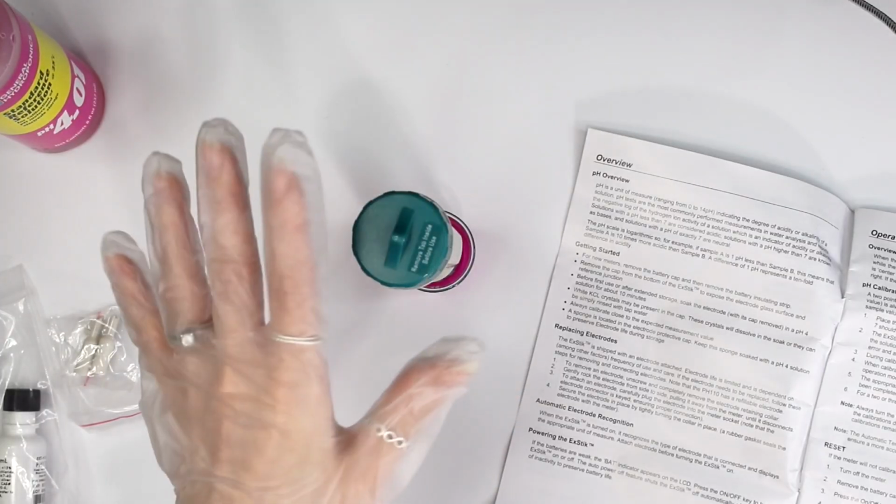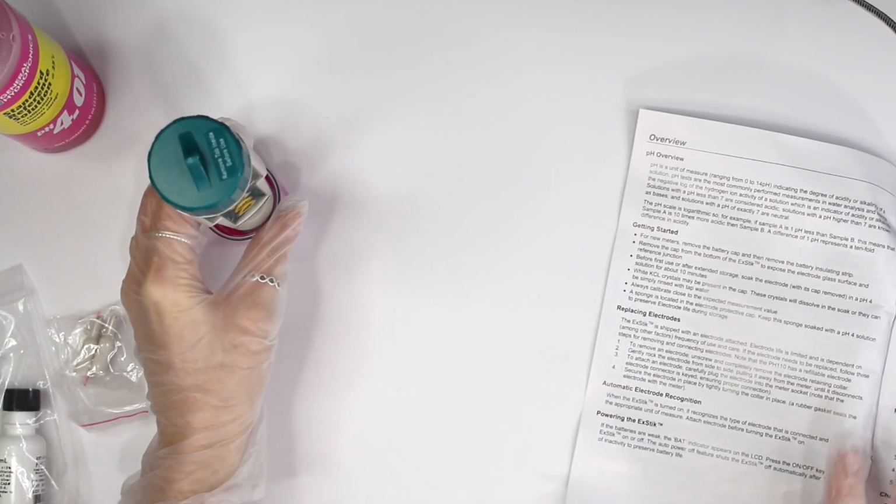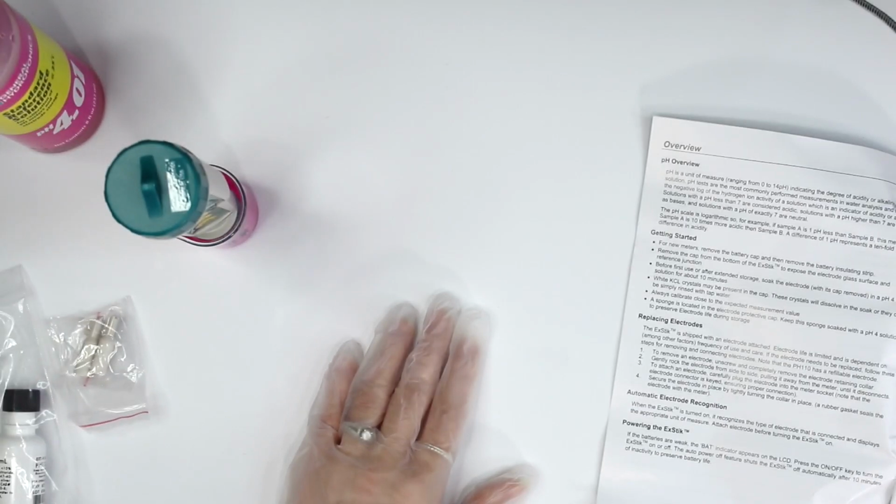Once this has soaked for 10 minutes, we do want to calibrate the pH meter, because whenever you get a new pH meter, you need to calibrate it to make sure it's accurate. Even if it says it comes calibrated, I still recommend recalibrating it. You want to recalibrate it monthly at least, or if you're not using it very often, every time you go to use it. I use mine pretty often, so I only recalibrate it about once a month, but that was the case with my old pH meter. I don't know about this pH meter. We'll have to see how well it does.